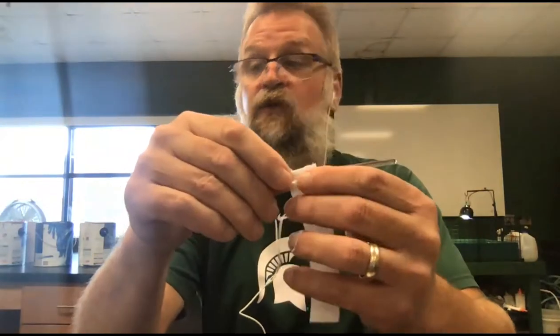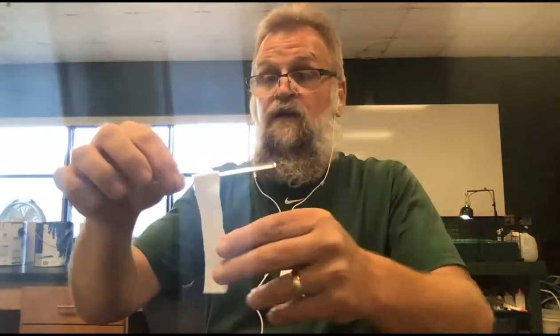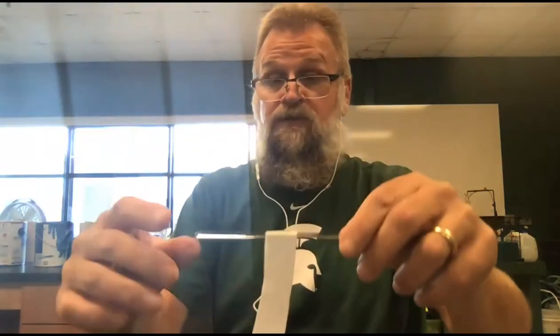I'm taking a glass rod and I'm going to tape this onto the glass rod. And then I'm going to take this dry piece of paper towel and put it in the beaker until it just touches the water. And as I do that, I'm already losing it.